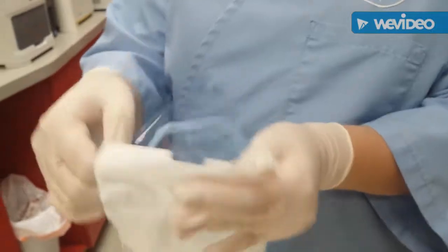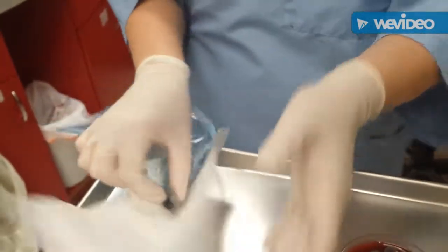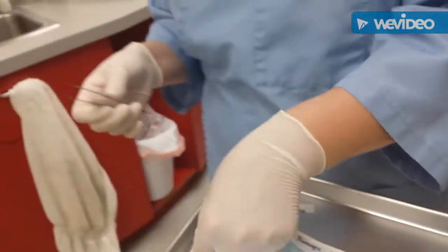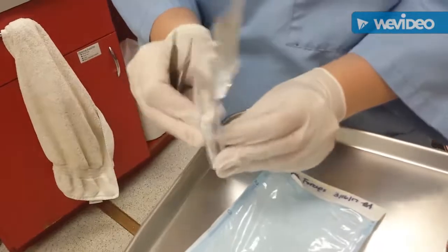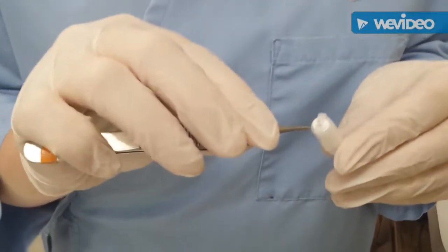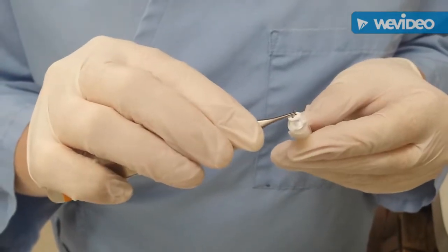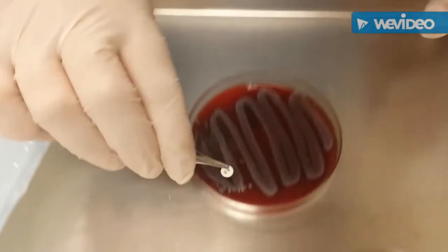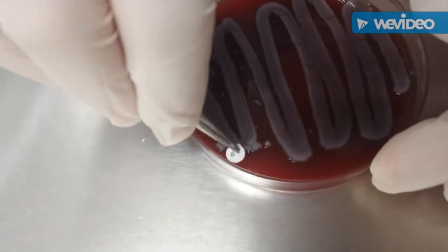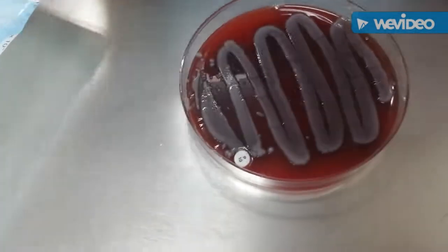We're using penicillin because we don't normally do this. So we're going to use a pair of sanitized forceps here. Then we're going to remove this, and gently grab a disc here. And then we are just going to place this in here gently where we have our colony growth. Okay.